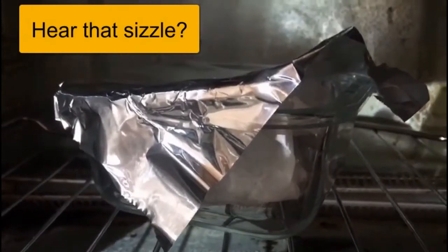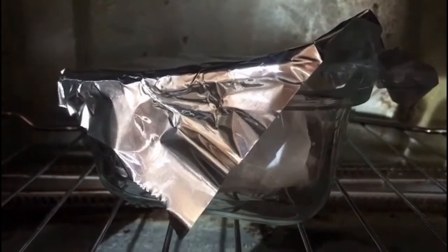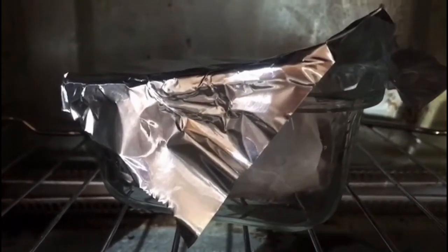You can hear it sizzle as it's releasing the water. This is the sand drying under medium heat.